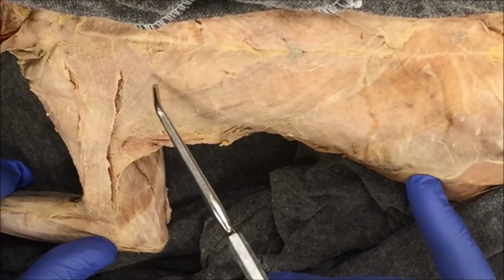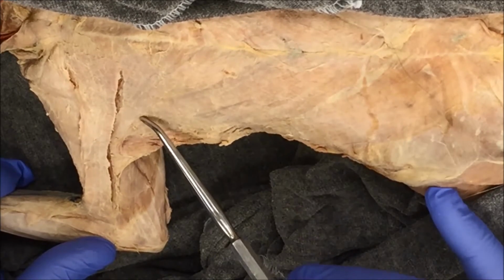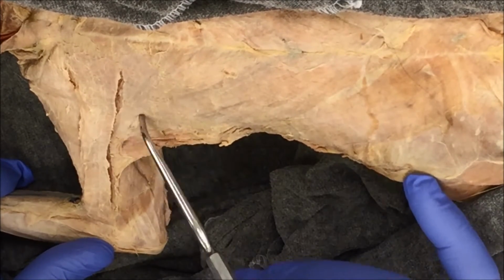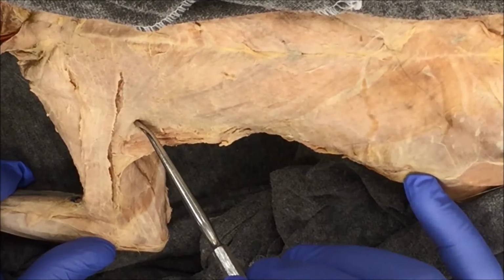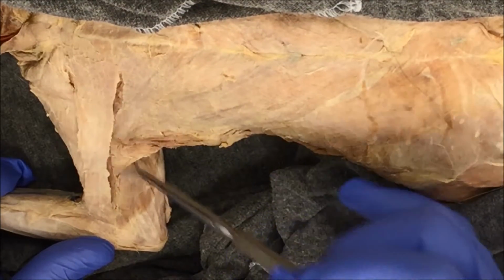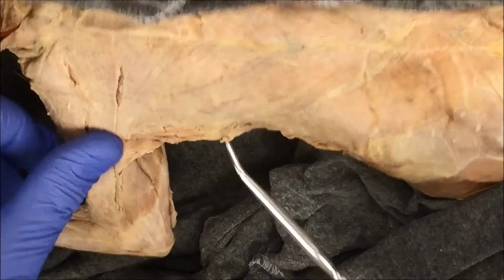Next, we'll dissect this muscle, which goes underneath the pectoantebrachialis. The easiest way to separate this muscle from this muscle here is if you look by the armpit, you can see the connective tissue line. You can see the line of demarcation around the armpit area, and this is where I would start picking at the connective tissue. As you can see, this muscle here has striations that go underneath the pectoantebrachialis. This muscle is called pectoralis major.